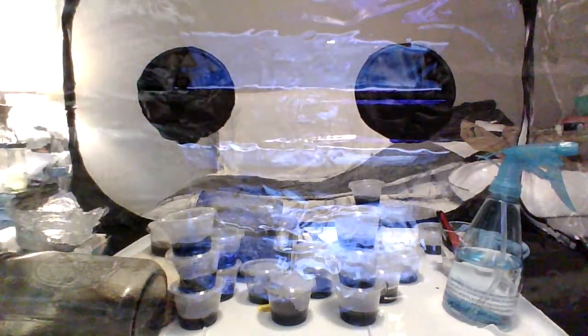And if you're lucky, the mycelium will start climbing up, sticking roots out through little mycelial hair filaments, and will start coming up through that agar quicker than the bacteria can come around the edges and grow into the surface of the agar. But you still don't want to wait around until the bacteria has time to meet up with the mycelium that's trying to get away from it, right? Bacteria is essentially a bunch of little wormy worms, little microbes that contaminate all kinds of stuff, not just fungal contaminants.